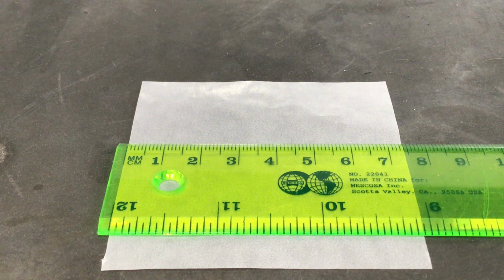It's the idea that that very last decimal has some flexibility to it, right? It's going to have some uncertainty, is what we usually refer to it as, due to the fact that whoever's looking at that, trying to make that measurement, the angle they look at it from might fluctuate enough to cause a very small difference in the estimation of what we're trying to measure there. And so if I was writing this down, I would probably say 7.40. If someone else said 7.42, that's not wrong. That's just what they measured for that.